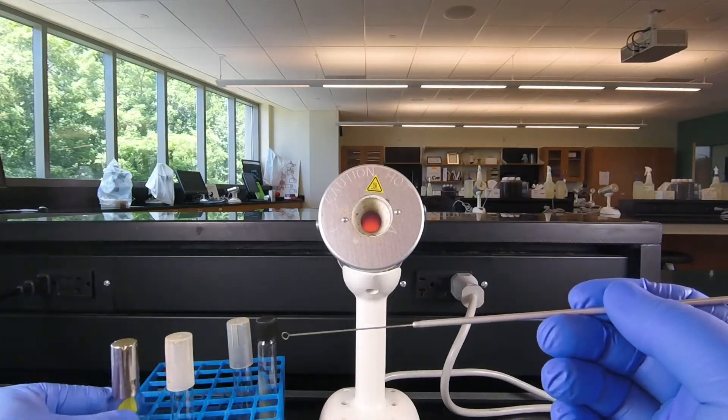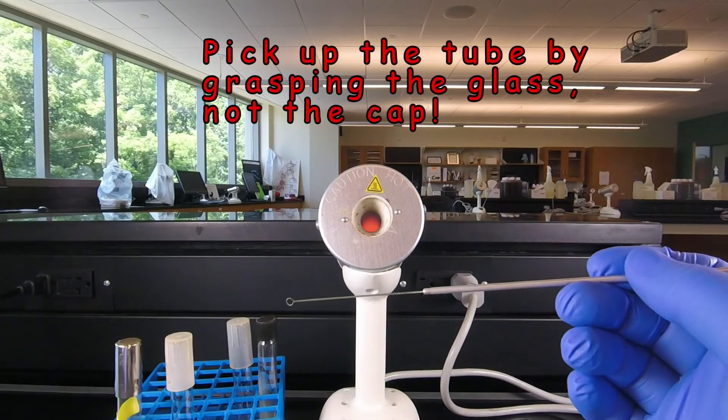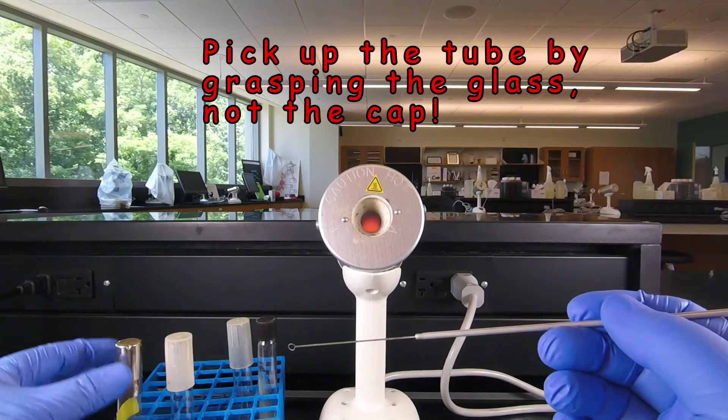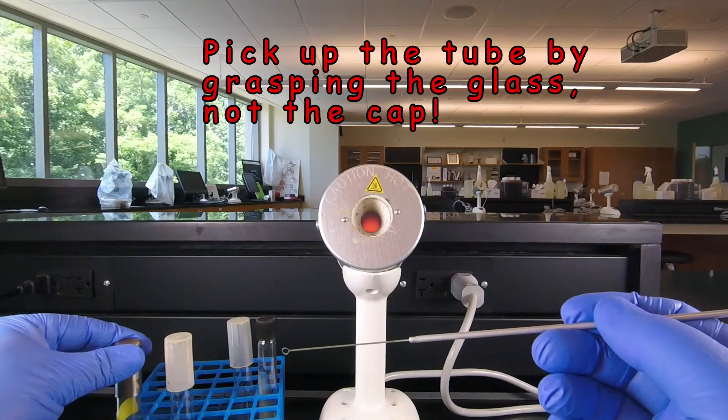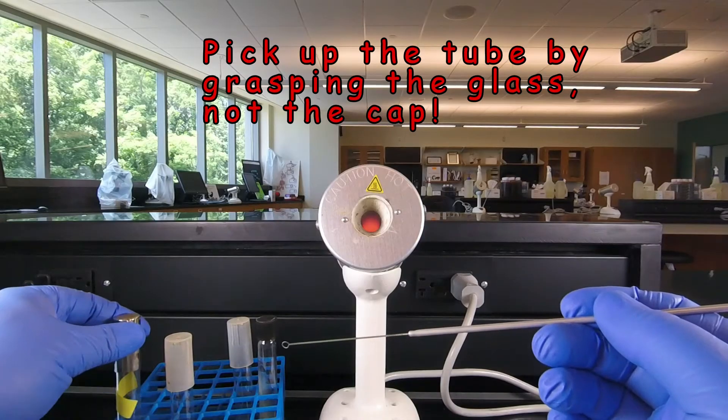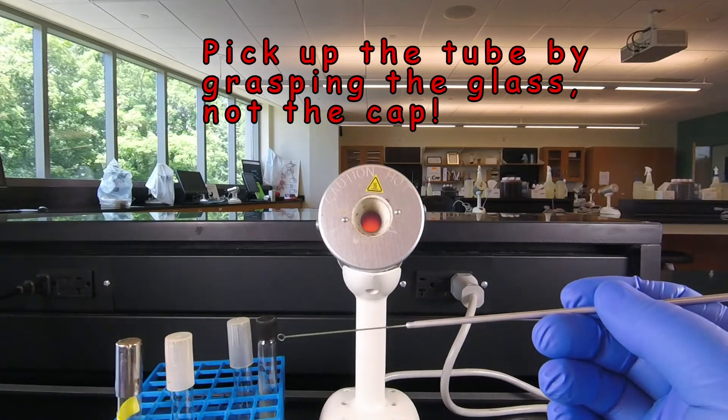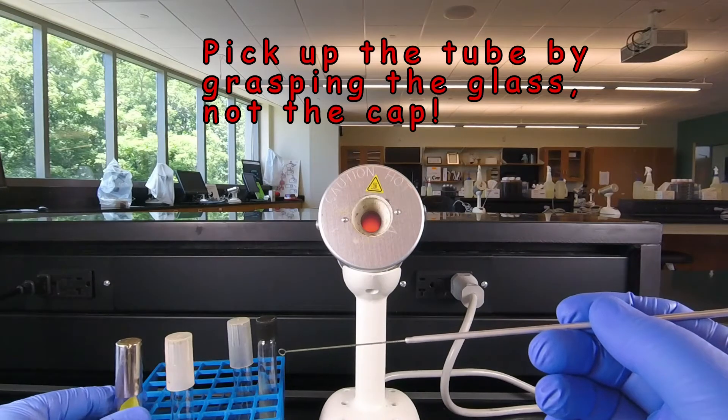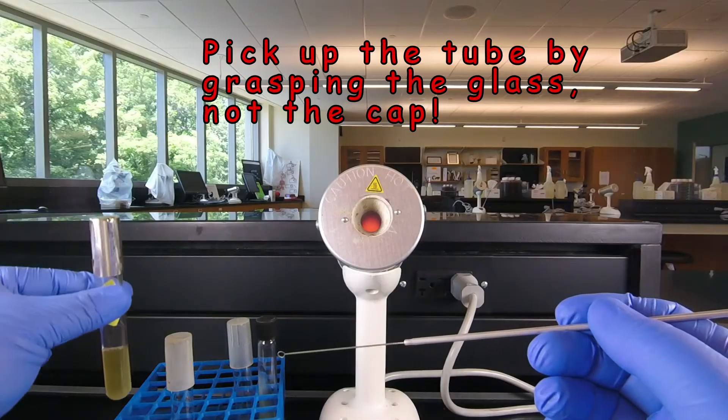Now one very important caution: whenever we are handling tubes we always pick them up by the glass not by the cap. The caps could fall off sometimes they're rather loose and if the cap is loose and you pick it up by the cap the tube could drop out, fall, break and contaminate your whole work area. So always pick the tubes up by the glass never by the caps.